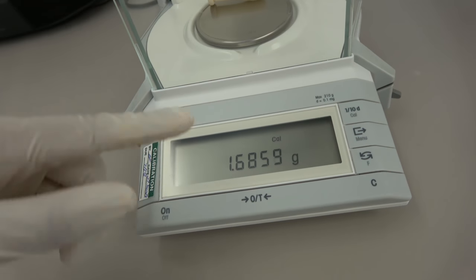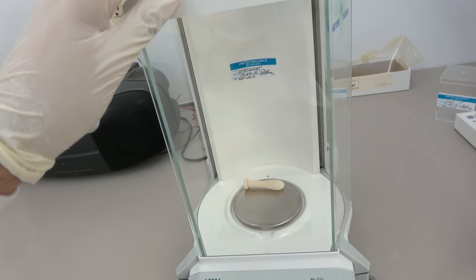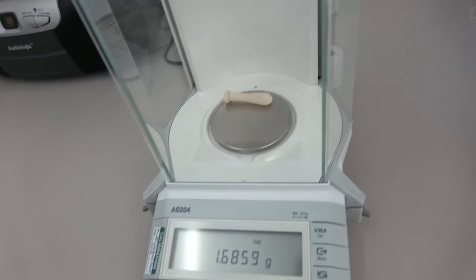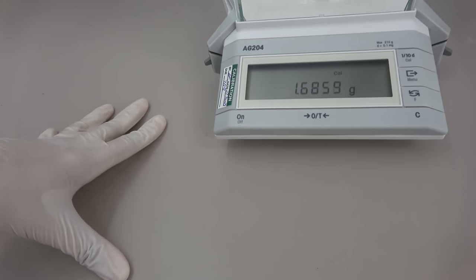Now here's a machine that I both hate and love. It's an analytical balance. I love it because you can weight things to many significant digits which is really cool. It's accurate. That can also be the annoying thing about it. It's really sensitive. You can be weighing something and the last digit is always going to be a fucking asshole. You're not going to know whether it wants to go one digit up or one digit down and it'll keep fluctuating. And you're just going to be sitting there watching it like please waste my fucking time some more. To minimize that you always want to make sure that all the little doors are closed on the analytical balance. That the analytical balance is centered. And that you're not pressing on the platform a lot because that can fluctuate the readings. So treat it gently.